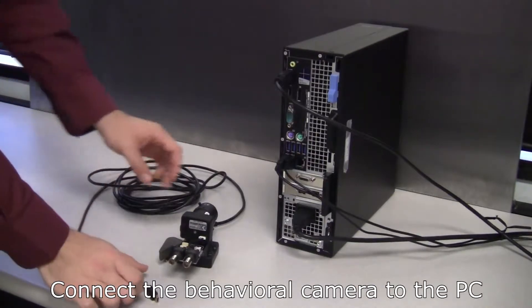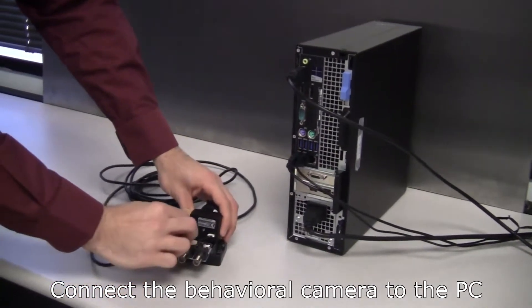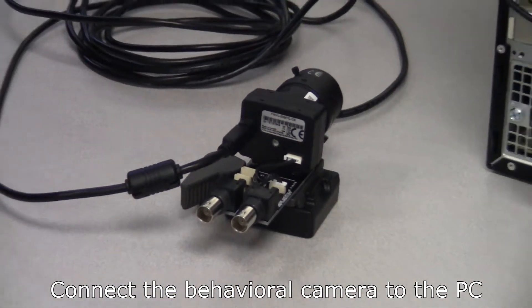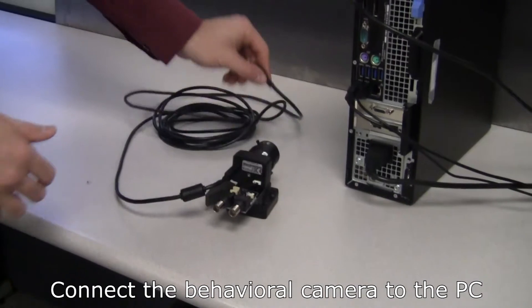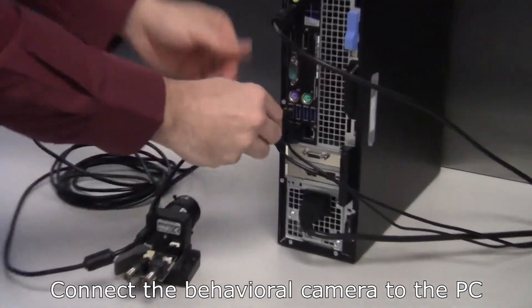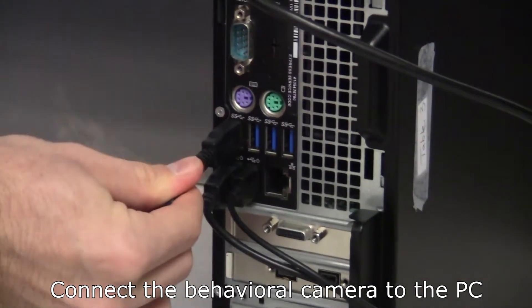Next, we will be connecting the behavioral camera to the Plexon configured system controller. Use the supplied USB cable to connect the camera to a USB port in the expansion card on the back panel of the PC. It is important to connect the camera to one of these ports for optimum handling of the video stream. Do not connect the camera to any other port.